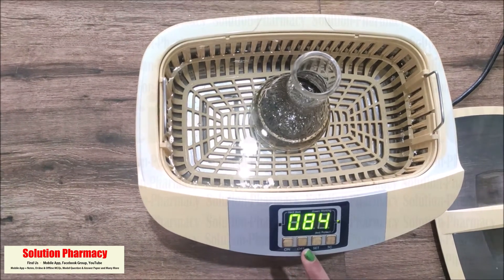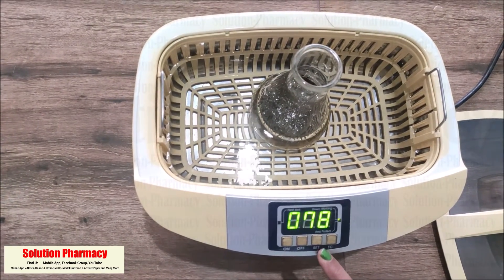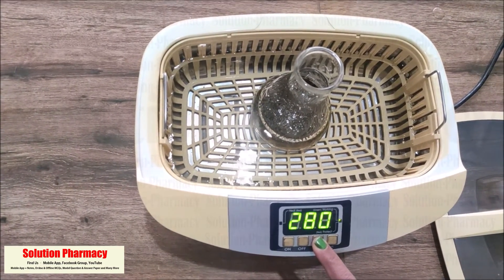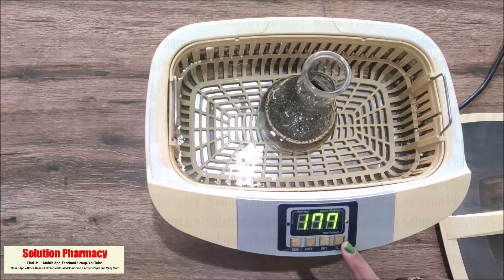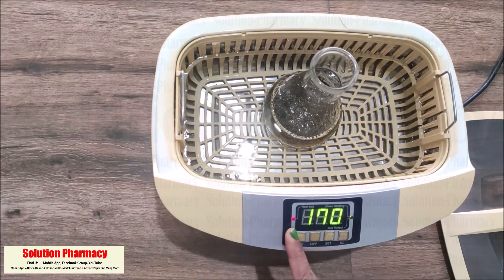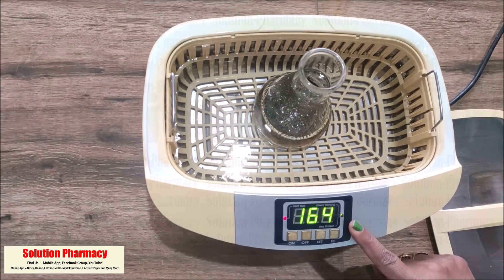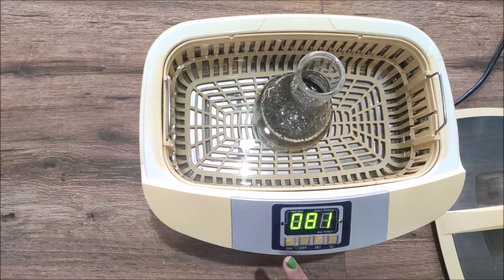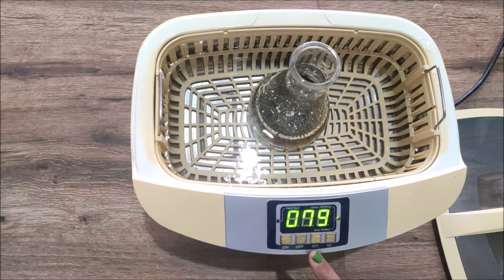There is a switch to turn on the ultrasound — we press this switch to start the ultrasonication. There is also a switch to turn off the ultrasound or ultrasonic energy. Next, there is a Set key to set the extraction time. The TC key means temperature control — pressing it turns on the heater, which is indicated by a red light. The green light on the right side indicates the instrument is on. When the display shows zero, meaning the set time is completed, the equipment will shut off automatically.